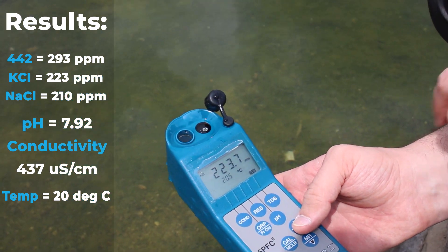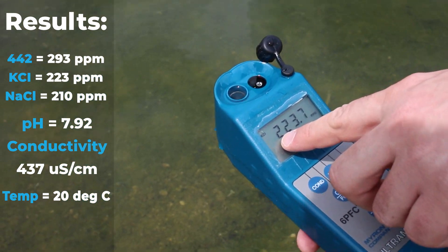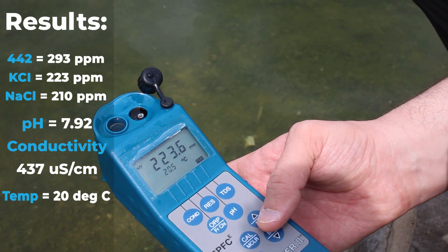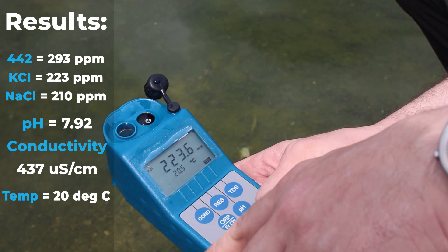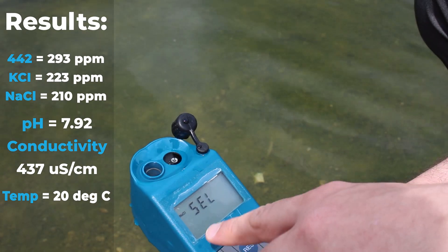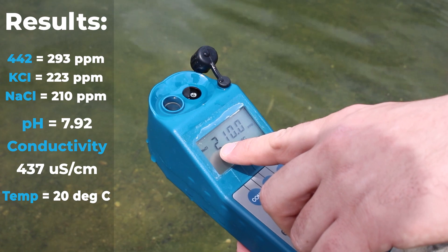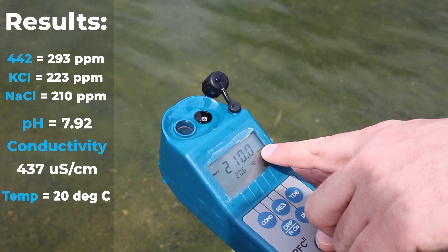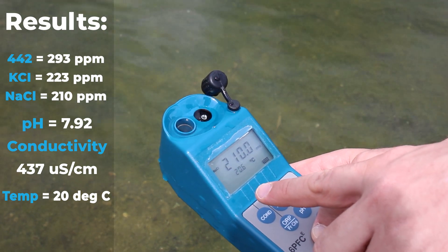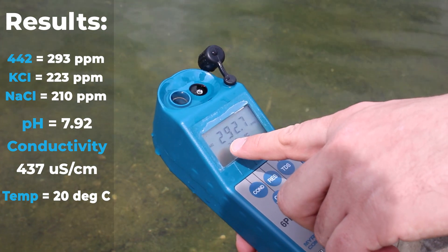Measuring TDS as KCL gives us 223 ppm. If we measure it as NaCl, the result is lower at 210 ppm of salts. Measuring as 442 gives us the highest value at 292.8 ppm.